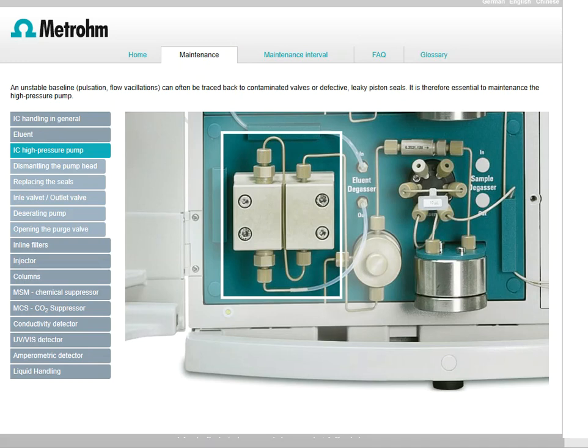So imagine for a minute that the mobile phase is getting pumped, and I'm just ignoring all the other pieces of the equipment right now. I'm only focused on the pump that's doing that mobile phase job. And right here it is. It's this kind of box that you're seeing over to the left-hand side. That is our high-pressure pump in the system.